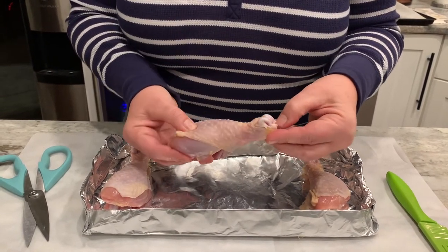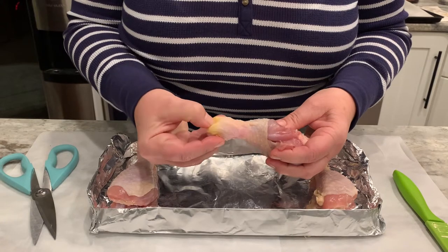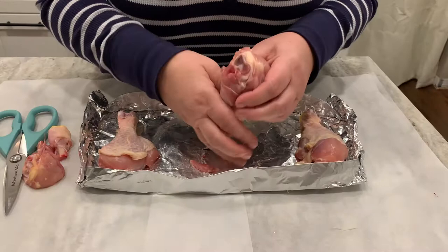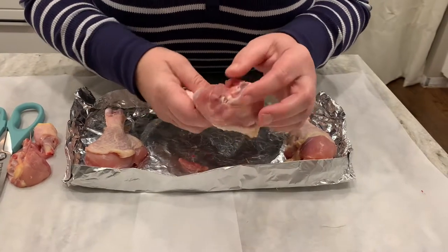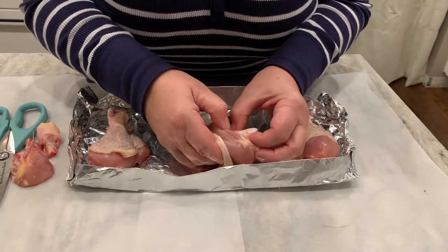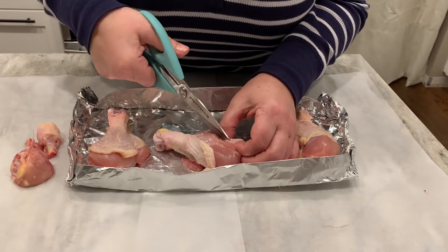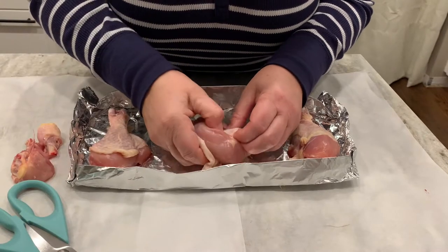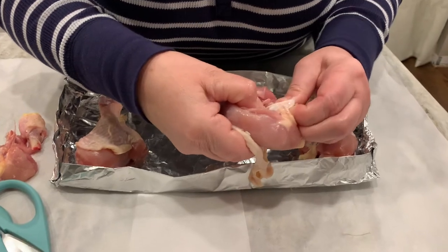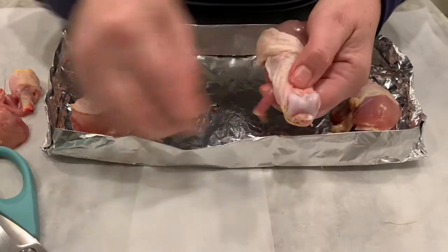If this cartilage wears down, that's what we call arthritis. You can see this is a hinge joint actually moving — this is the joint, not the skin. At the proximal end, this would be the knee joint. You can really see the ligaments here; they connect bone to bone. See how tough and fibrous that is as I cut through it.